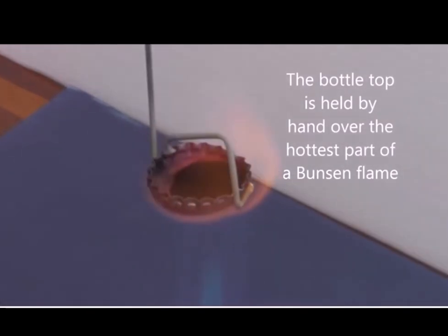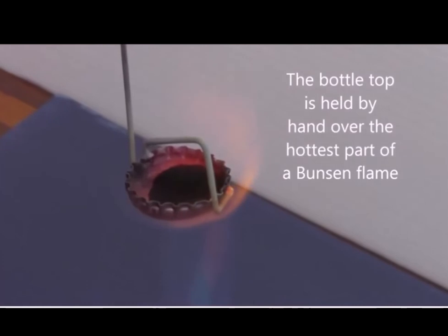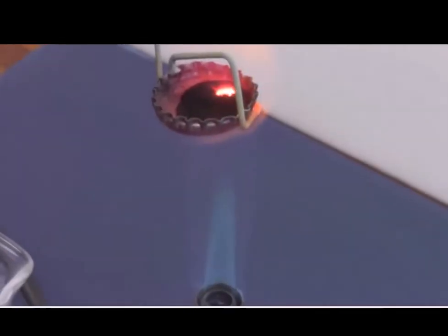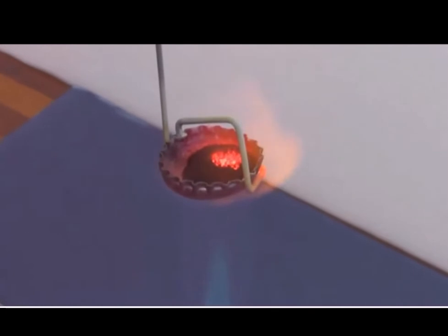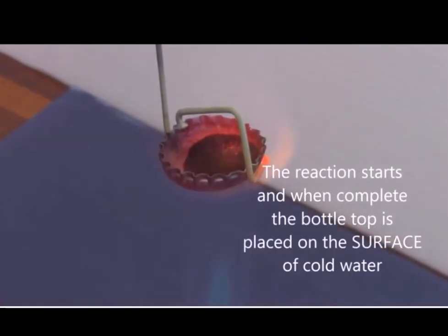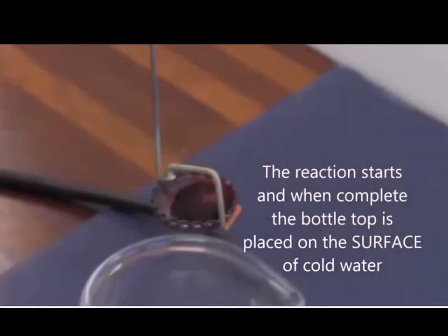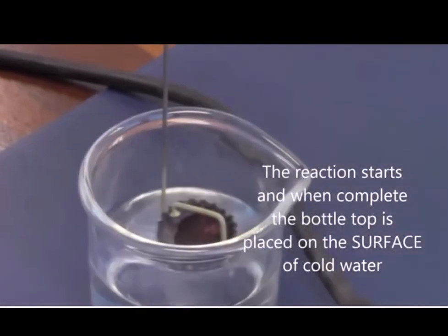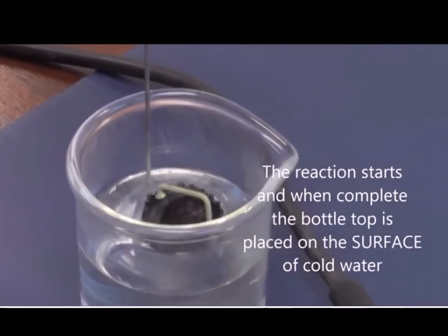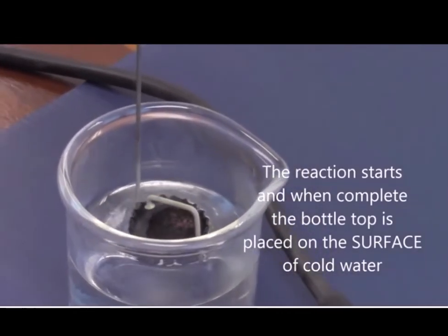So again, it takes a moment or two for the heat to go into it. But then once the heat goes into it, we should see a reaction. There we go. So the mixture flares up. A little bit of a flare. It's not as vigorous, obviously, as the magnesium one, but a reaction nevertheless. So it would suggest that carbon isn't as reactive as magnesium, but certainly more reactive than the copper.